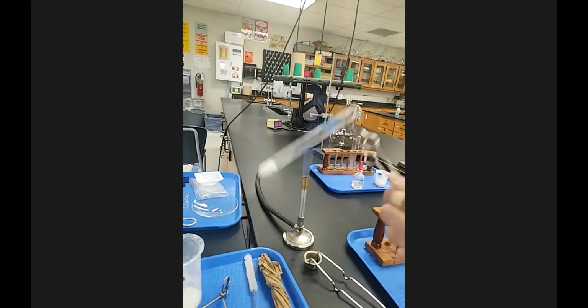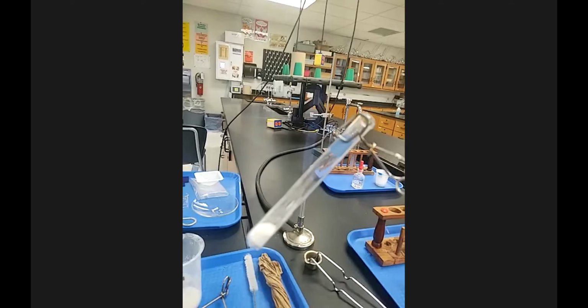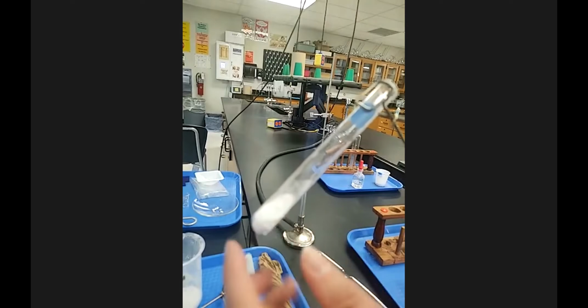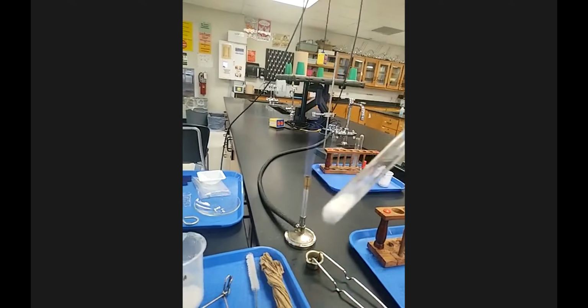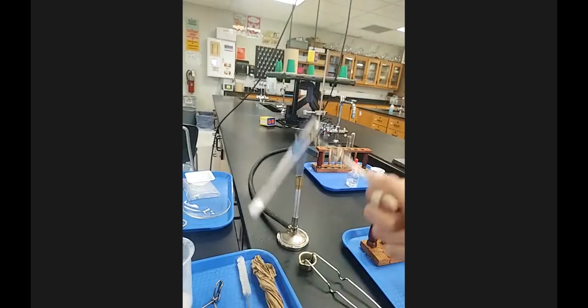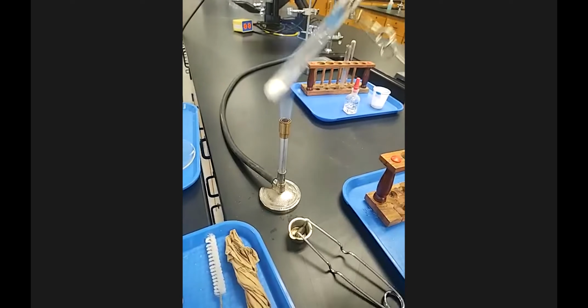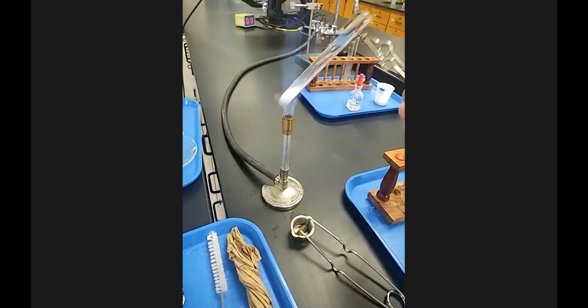I want to do it at an angle, and yes, I'm going in and out of the flame because this flame is plenty hot to heat it evenly, because I want the stuff in the middle to be heated, not just the stuff on the outside or on the bottom. So it's a good lab technique for this. It's literally just a circular motion with my wrist. So for this one here, I'm going to do that motion now. And notice that I am literally just going in and out of the flame.